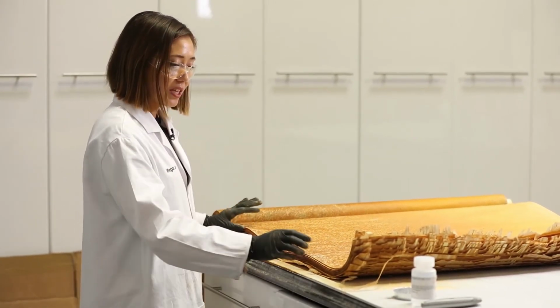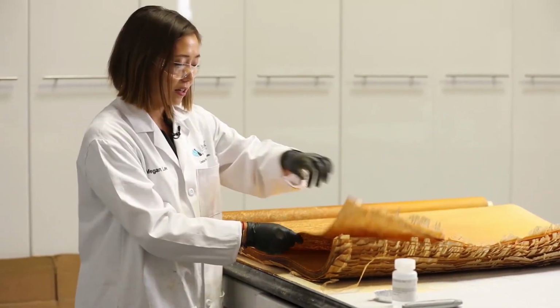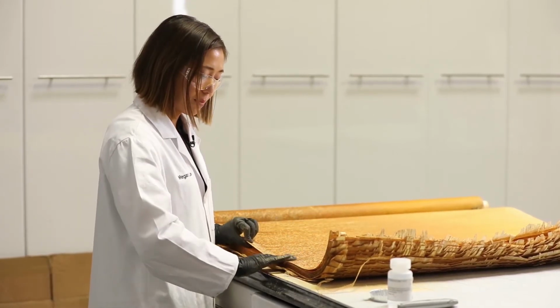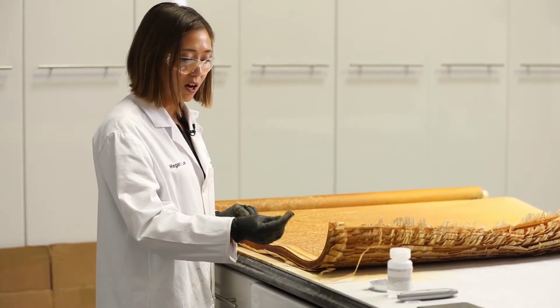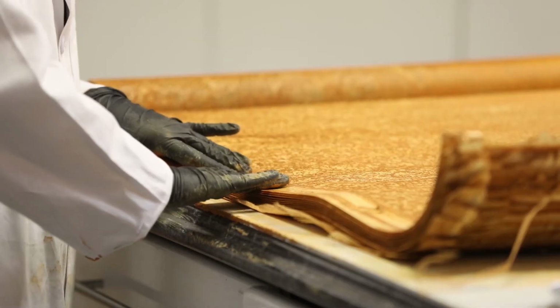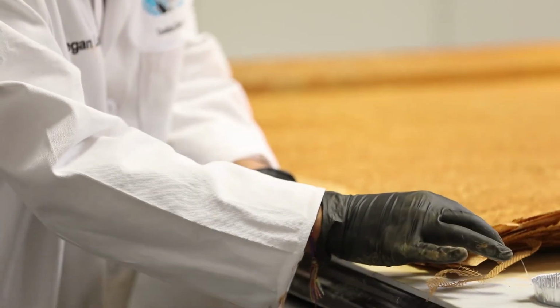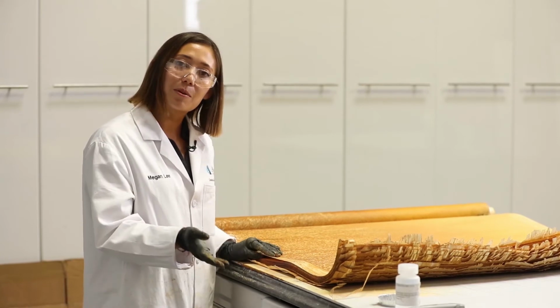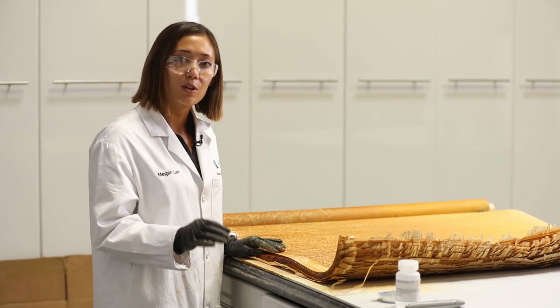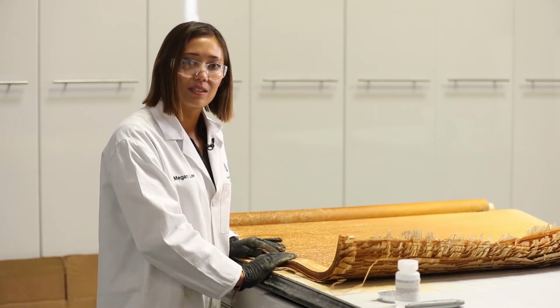The components of the membrane leaf are two outwardly facing pieces of membrane held together by the glue lines. We'll inspect the glue lines to look for any damage which would cause a loss in permeate quality. In order to see the glue lines, we'll wipe away the foulant material and inspect to make sure that they are intact. These glue lines are intact, and that's what we would expect given our wet test results, as the rejection, although a little bit below normal, didn't suggest significant damage to the internal mechanical components.